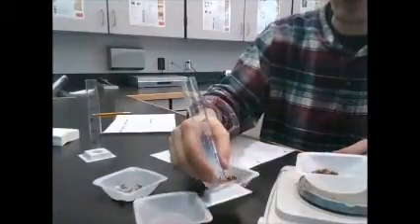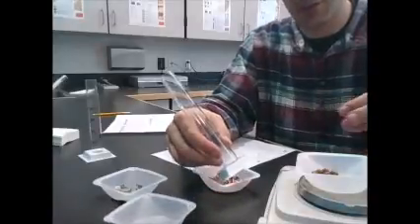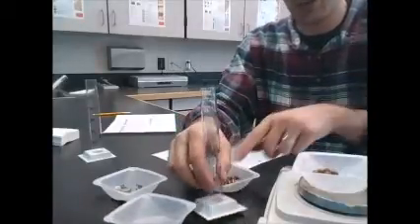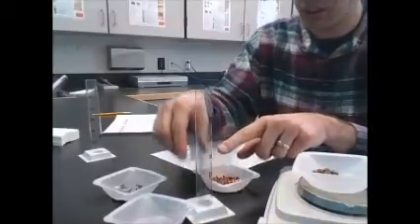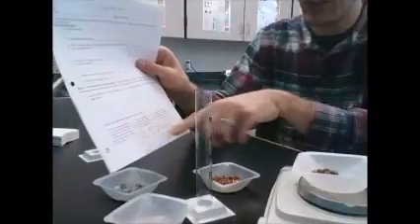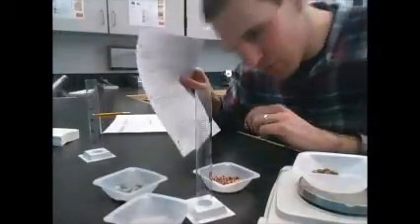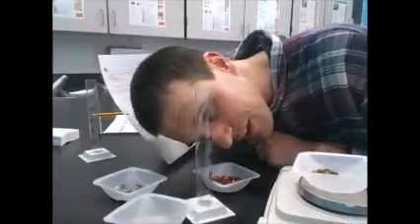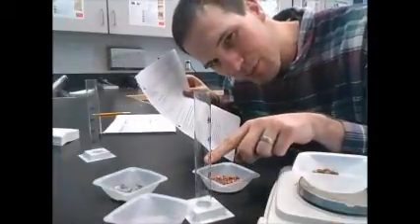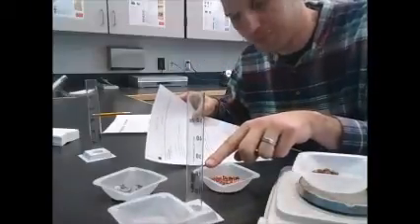So we've also got some graduated cylinders, and we're going to use the water displacement method because these have a weird shape to them. So I'd want to fill it up to a certain amount of water, and on our little liquids lab direction sheet, it kind of shows what we're looking for. The water might form a little curve on it called the meniscus. So when you are eye level with it, you're going to see a little bit of a curve. You want to measure where the bottom of that curve is. That's how much starting water you've got in there.